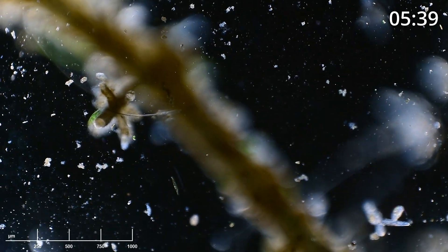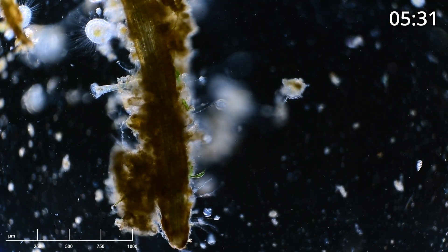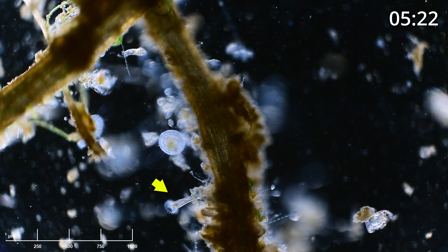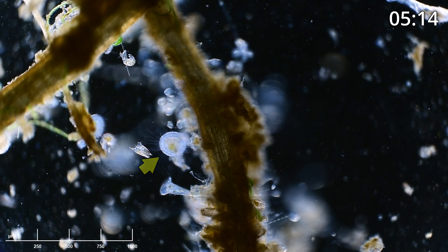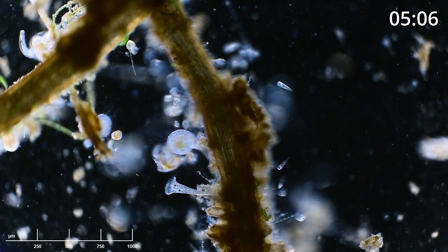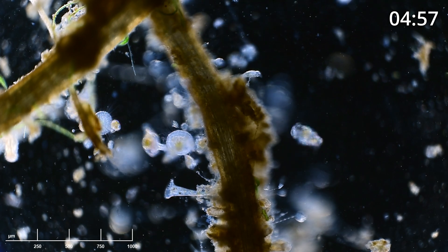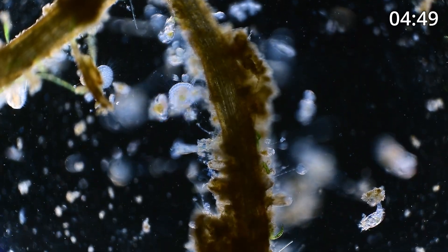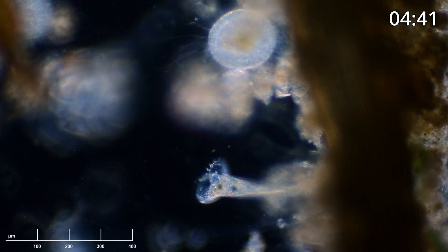Just so you know, when looking at a slide like this with roots, it creates a lot of depth and makes it very difficult to keep everything in focus, so you'll see me traveling in and out of focus. This is a great scene — we have a stentor, which is a single-cell ciliate, down toward the bottom hanging onto the root, and right above it we have a heliozoan, which is an amoeboid with axopodia — it kind of looks like hair sticking out but it's really part of its cellular material. Stentors can swim and also attach themselves; they're known as trumpet animalcules. They have cilia ringing the oral opening that creates a vortex, which brings food through into the oral opening of the stentor.